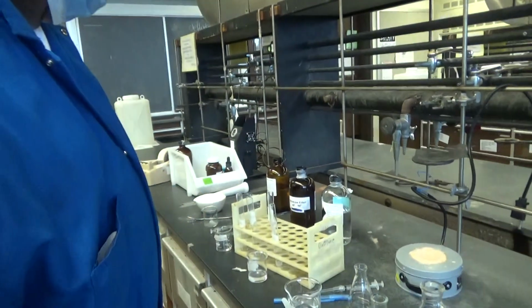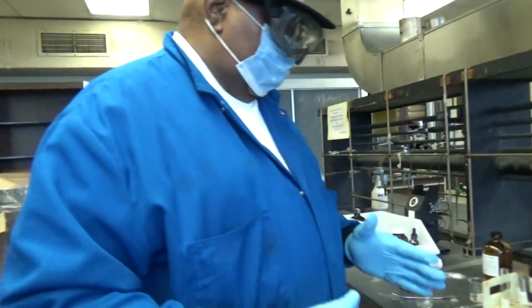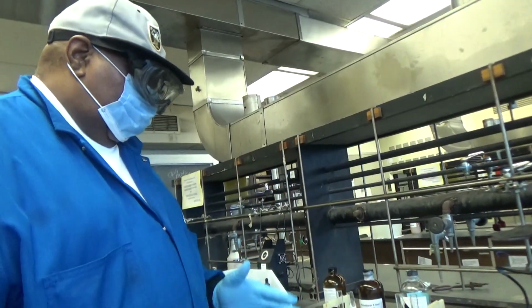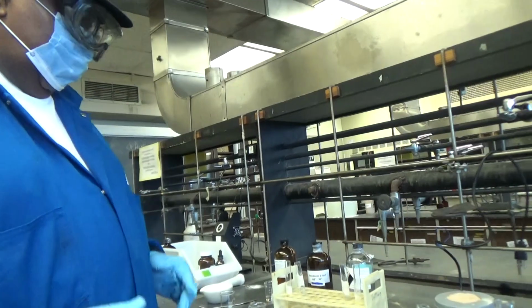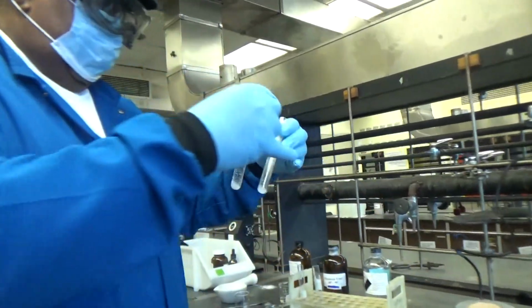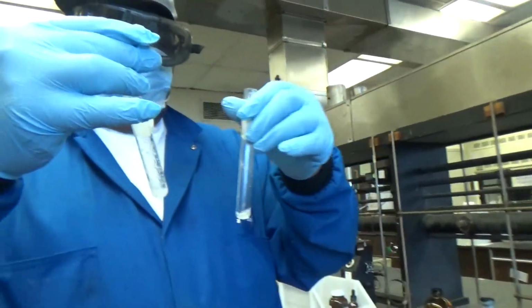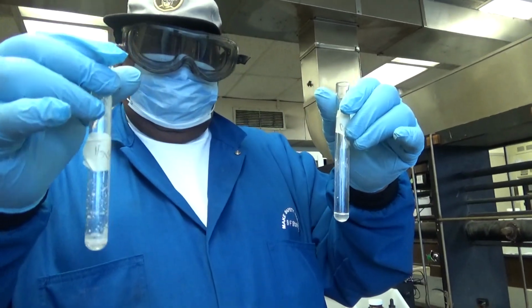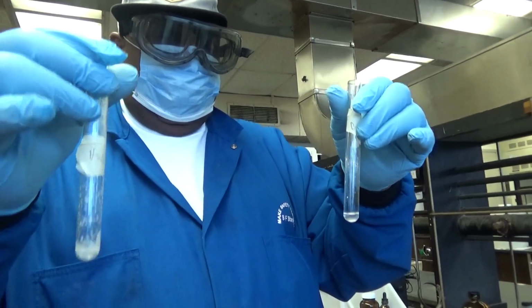So now, you had to select 2 solvents and discard 2 solvents. You need to select petroleum ether and water because they do not completely dissolve pure benzoic acid at room temperature.